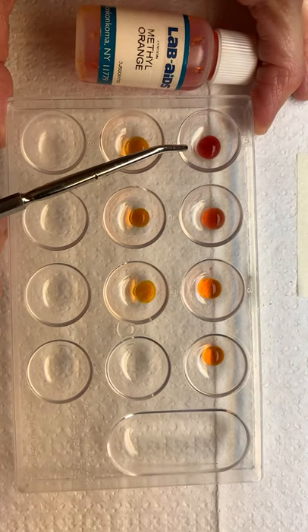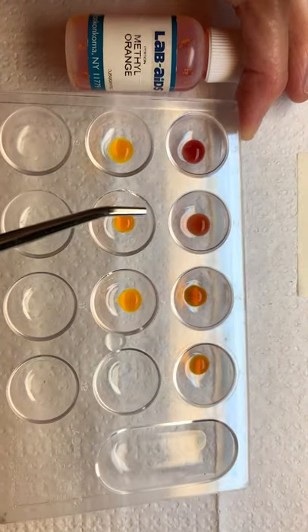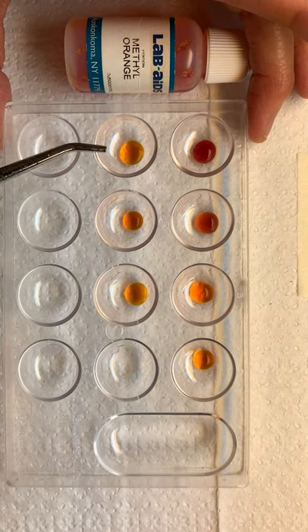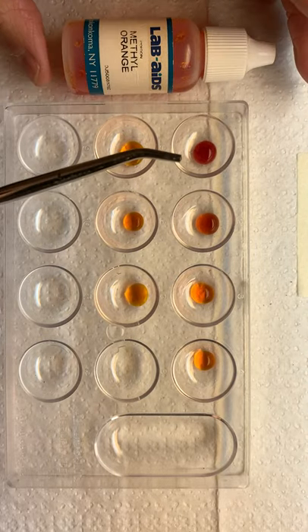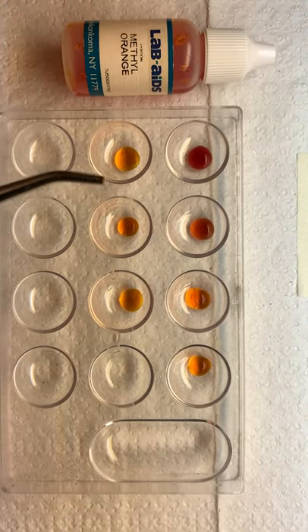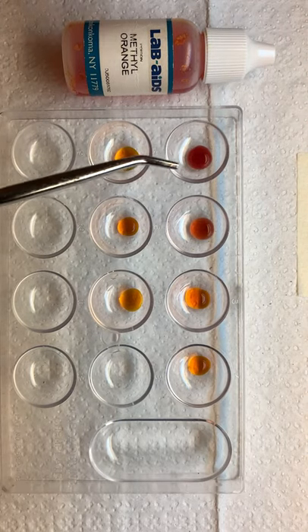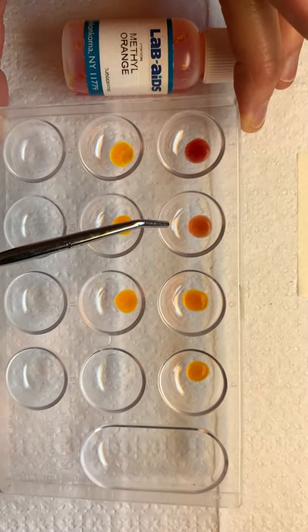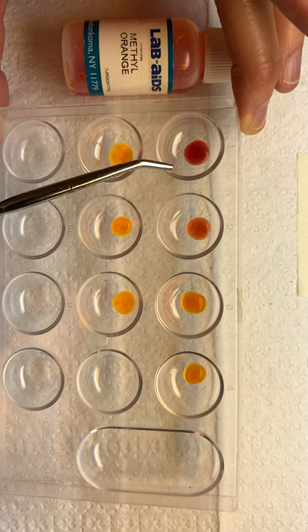We know that there was a color change at the first well and at the second well. The third, fourth, and all the way to the end of the seven wells didn't have any change. We do have methyl orange turning red, and if you'll recall in our original experiment, red was what methyl orange changed to when it touched pH one. We could still say that the second well was a pink or lighter red, so we're still in the spectrum for acids and methyl orange.